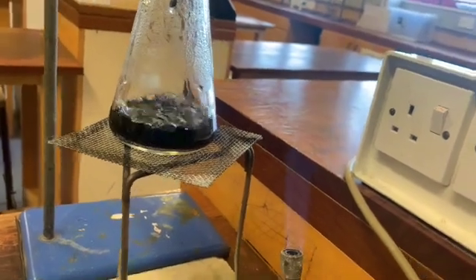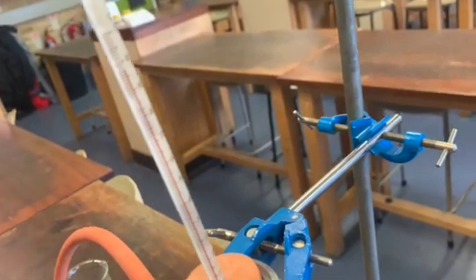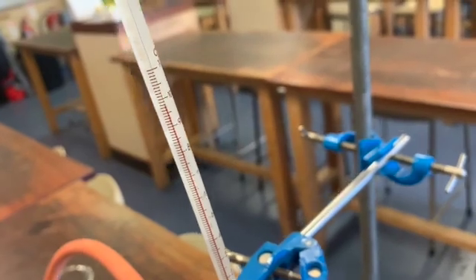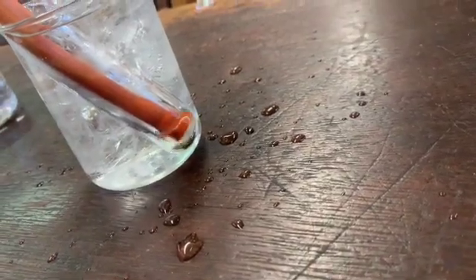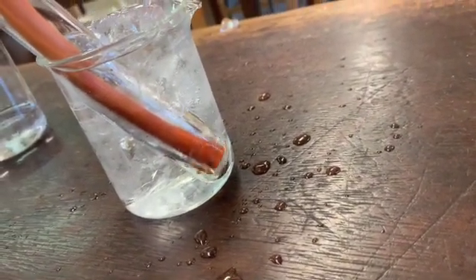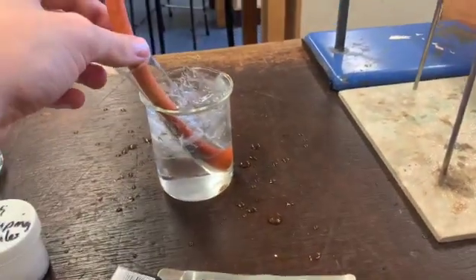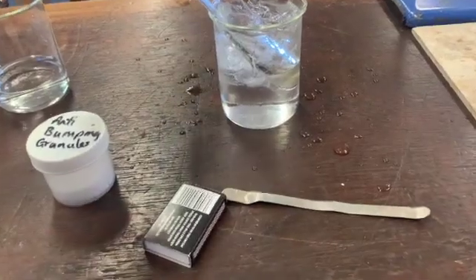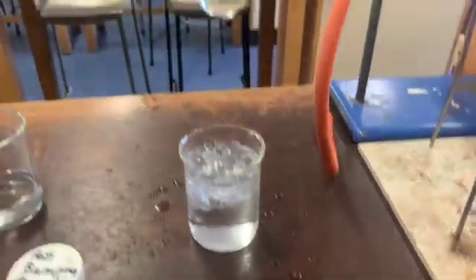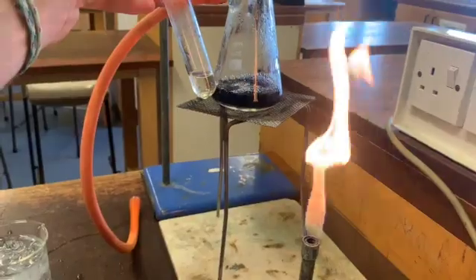We don't want to keep it boiling constantly. We want to keep the boil quite mellow. You can see that the temperature is very, very close to 100 degrees. Here you can see my pure water coming out of the bottom - how exciting! I've just finished my boil. To prevent this water from sucking back into the tube, I'm just going to remove it from there and let that come out. And now I should have my pure water here, and you can see that's completely changed.